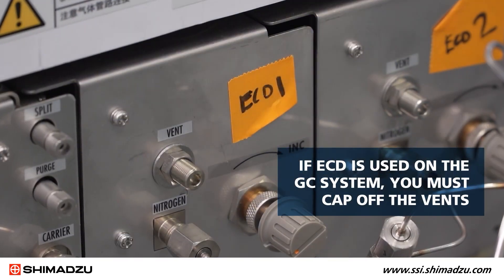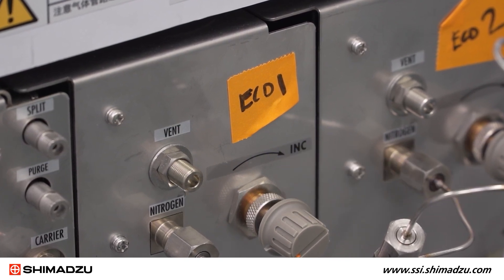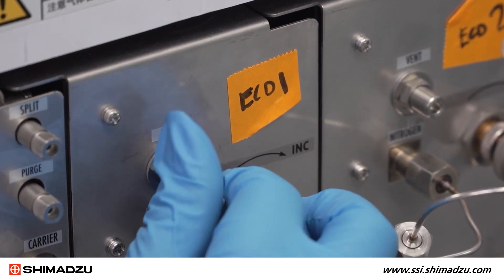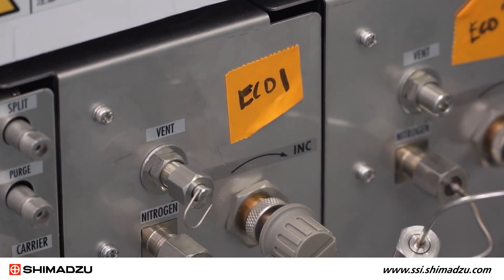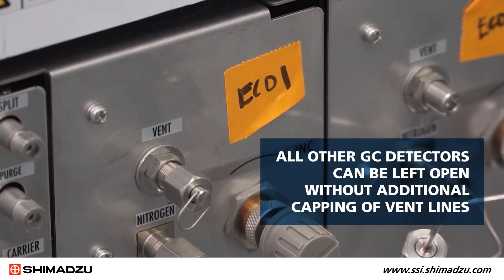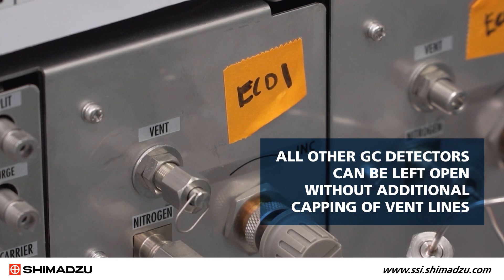If ECD is used on the GC system, you must cap off the vents. While the gas is still flowing, locate the ECD vent in the back of the GC. Cap off with three aluminum gaskets or red rubber O-rings that come with your Shimadzu GC. This will fill the ECD cells with inert gases. All other GC detectors can be left open without additional capping of vent lines.